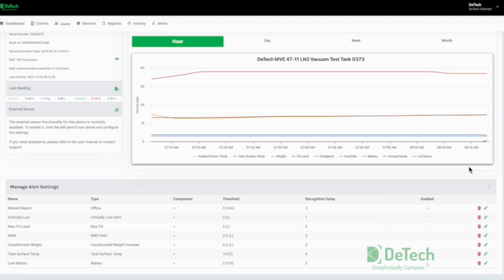So we wanted to share with you what happens on our dashboard when we put our device in access mode. As seen in the prior video of the app, when we remove the lid, the device goes into access mode, sending real-time telemetry every 3 to 5 second intervals. It's sending data packets up.